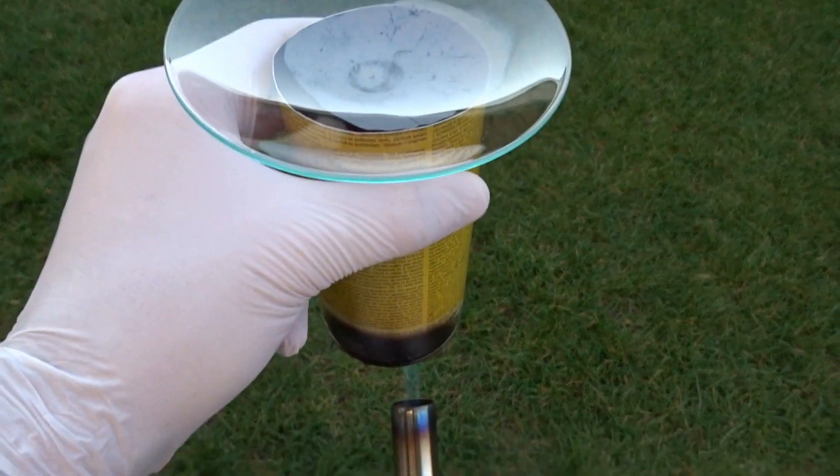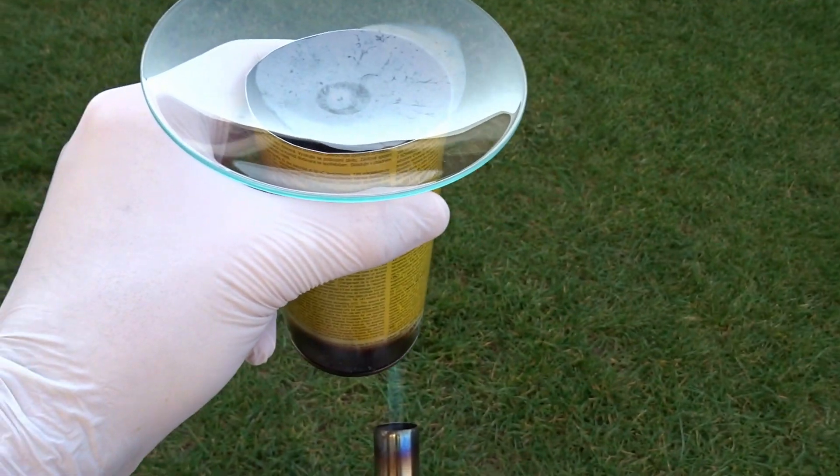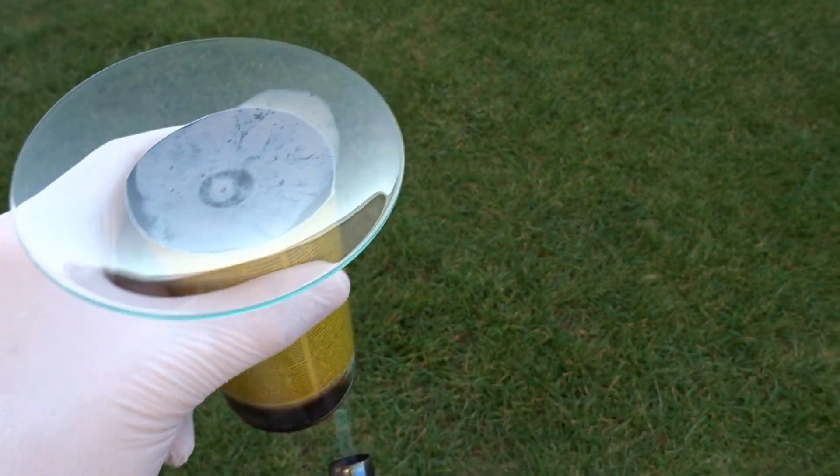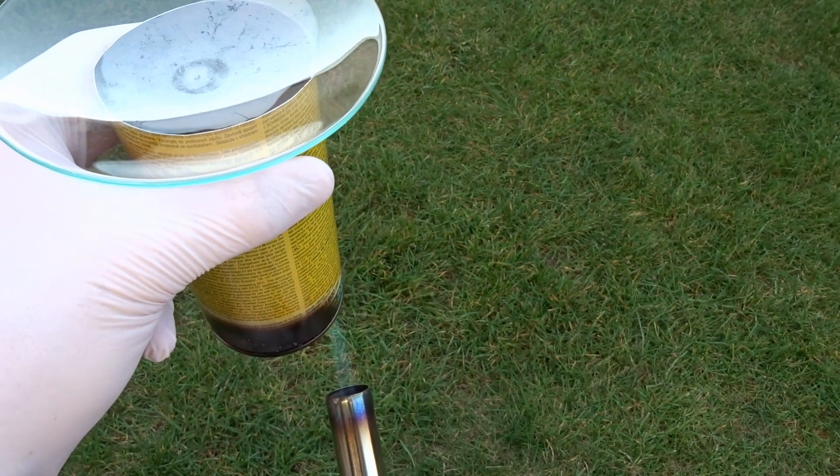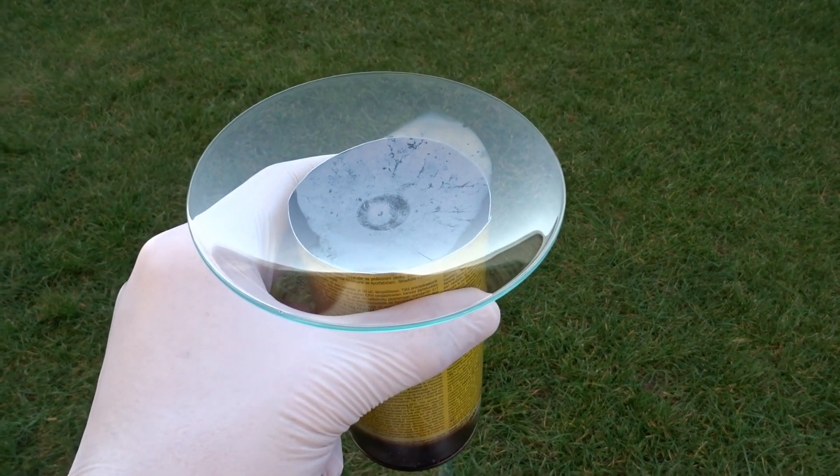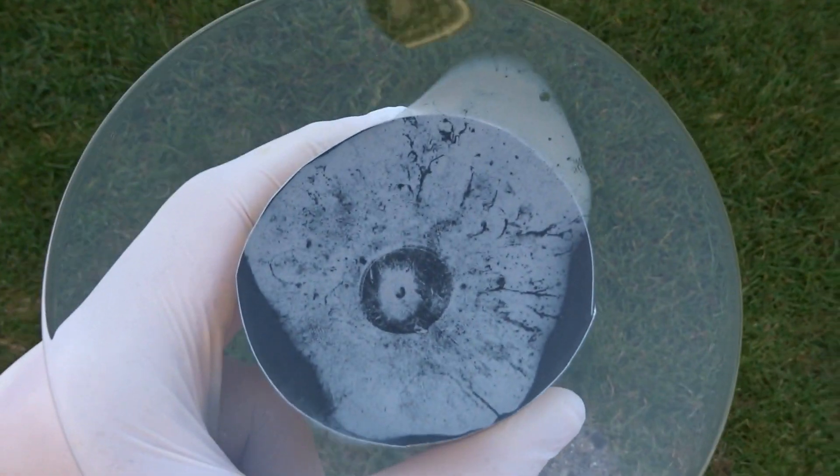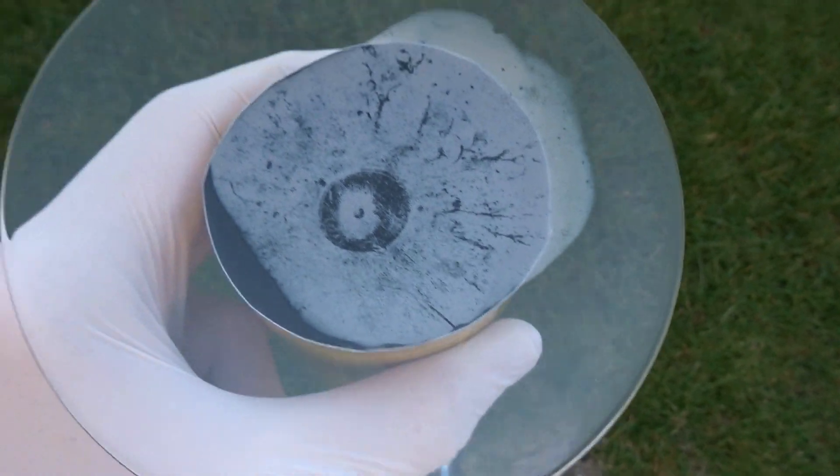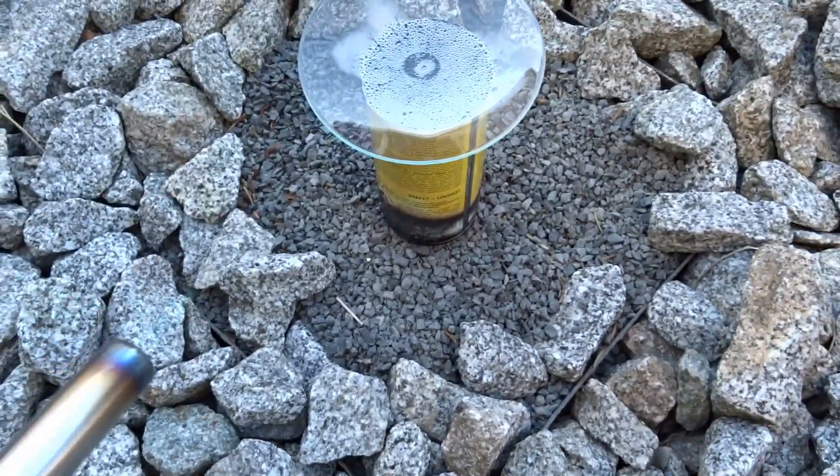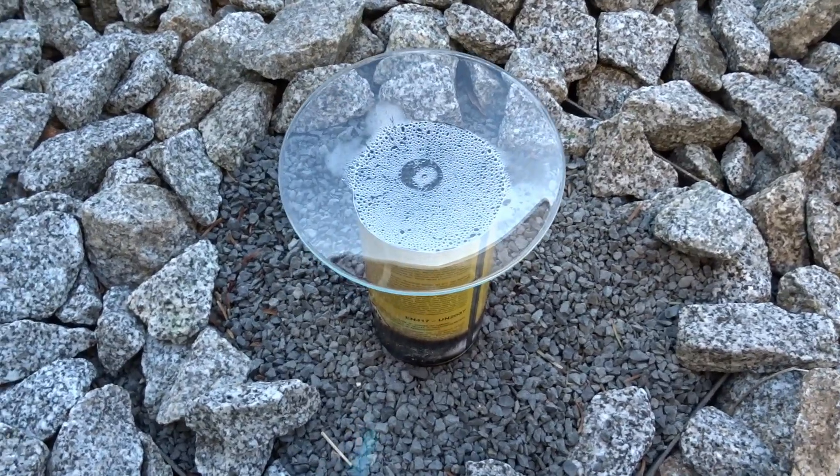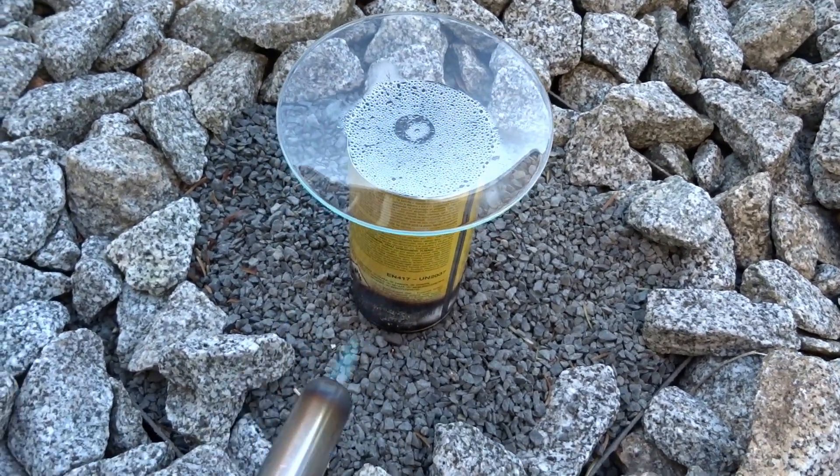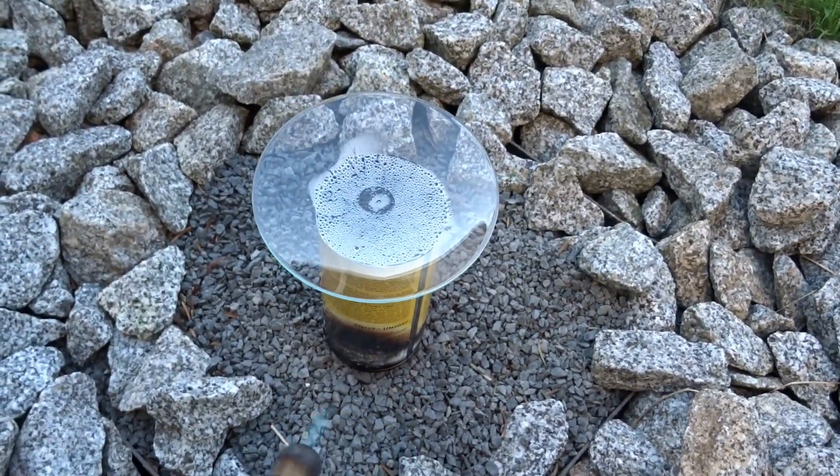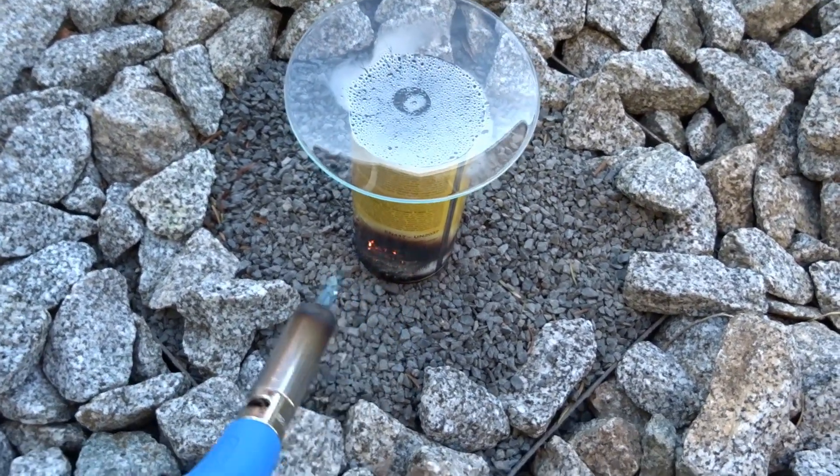Something's going on inside there and the paint starts to burn off which is rather unpleasant. But I think the chromates here are of more concern than the paint. The only problem is I don't know what stink is the chromate and what's the paint. Maybe you see something inside happening. So the paint is off. The nasty stench has gone away. And there is a water formation. It might be water that's already present in there or it's a reaction product. We'll see.